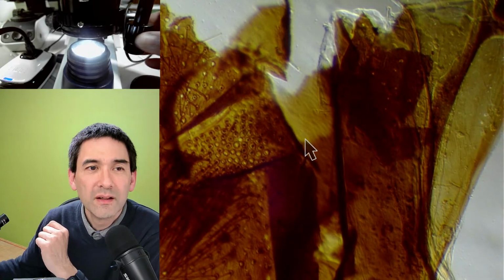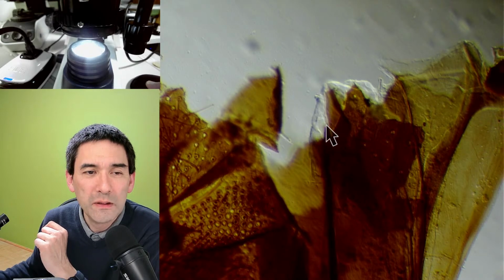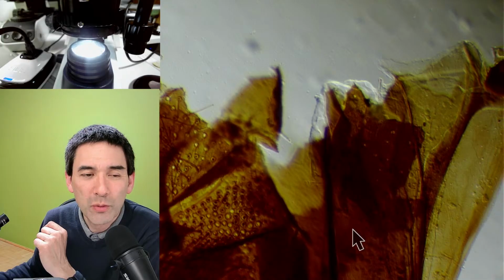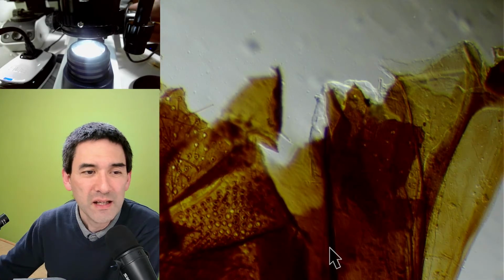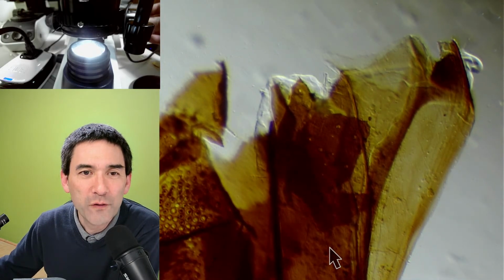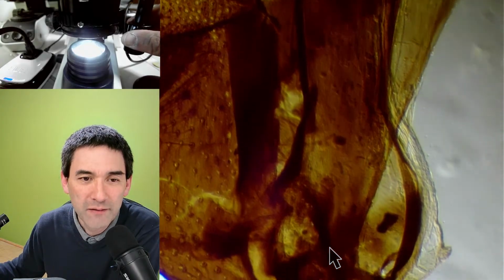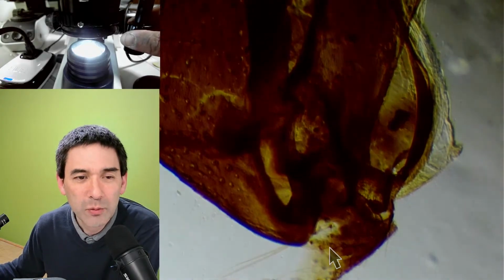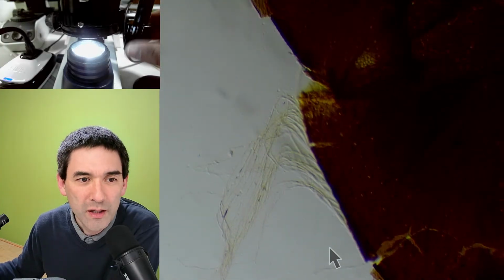Then you can see that sometimes you are able to see this oblique lighting that you see over here, but not so much in the rest of the structure. So I think this tells me that if you want to see it quite well, the structure has to be sufficiently thin for you to see this oblique lighting effect, which probably explains a little bit why they used it back in the 19th century to observe bacteria this way.